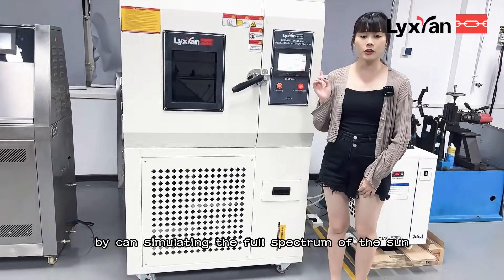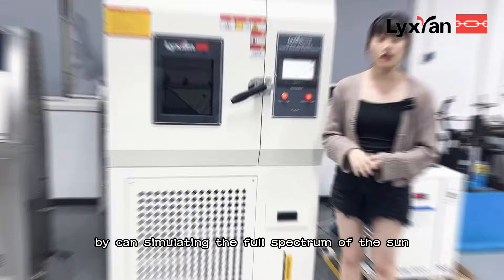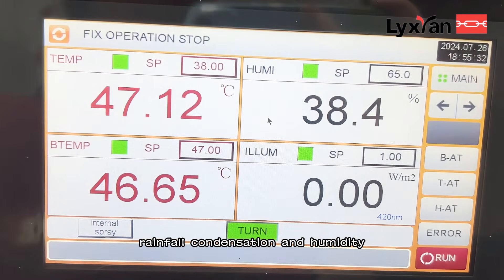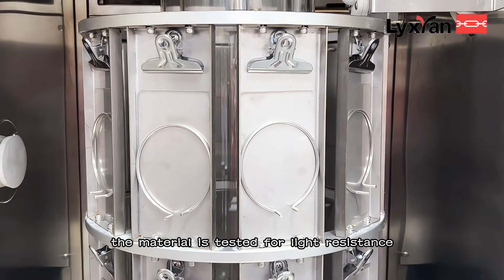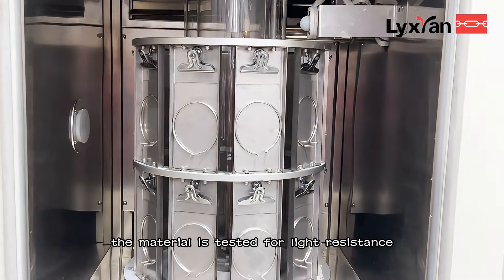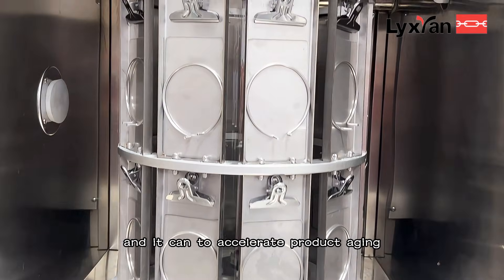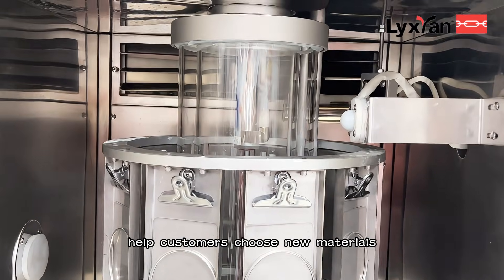It can simulate the full spectrum of the sun. It can simulate light, temperature, rainfall, condensation, and humidity. The material is tested for light resistance, color fastness, and it can accelerate product aging, helping customers choose new materials.